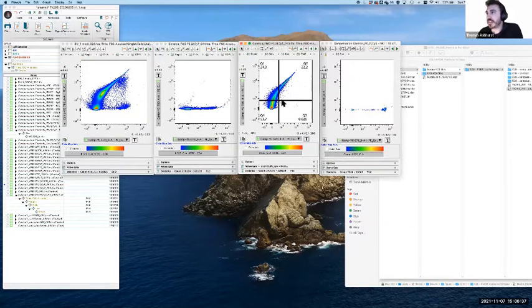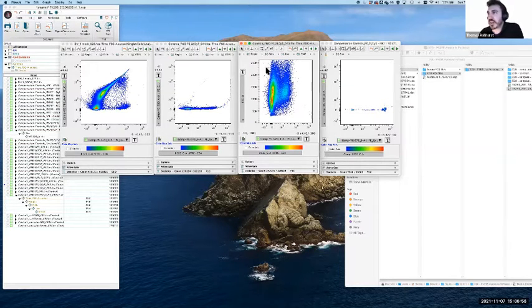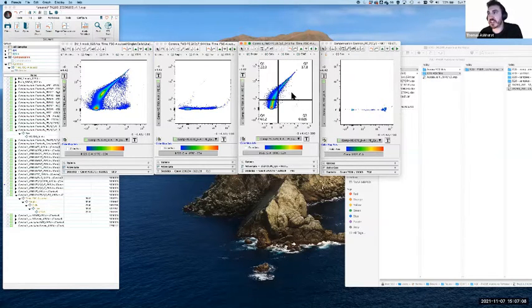So this is kind of where we identify that something is going wrong. And this is just a really simple one to lean on: this sample physically cannot have PE-Cy5 signal. It wasn't added, therefore it cannot be there. So if it has apparent PE-Cy5 signal, it's coming from spillover. We may actually notice this by looking at something like, let's just say, forward scatter in this case. That doesn't look incorrect necessarily, but what we have to realize is that nothing should be in this PE-Cy5 detector because it doesn't have that signal. And so obviously in this case, we go hunting and we see that, yes, it's a spillover event.